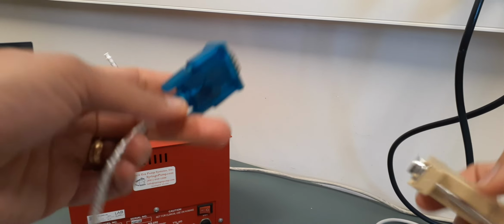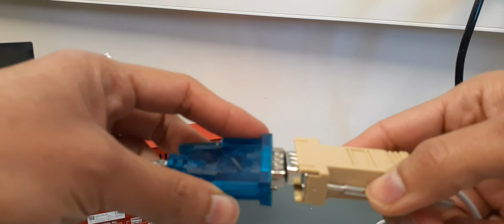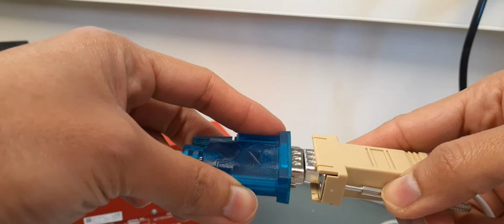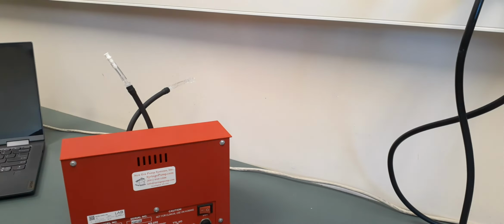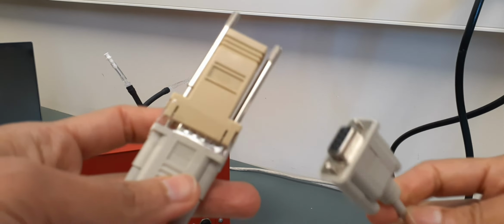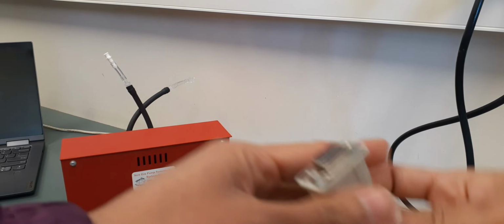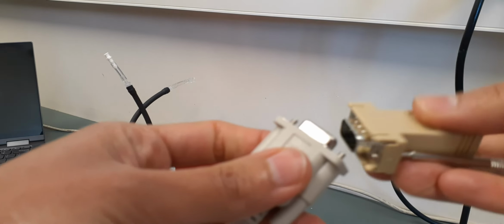So you're gonna just match these 2 ones together. As you can see, I got this type of adapter, so this one doesn't really match. So they have a gender issue. How do I resolve it? It's to use the extension cable. Just see, I've got another one that is already made. So I use an extension cable which can change the gender. So this one will easily go to that. So they are matched.